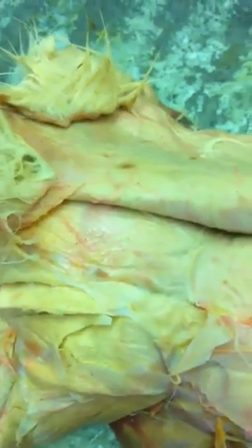What else are we missing? We're missing the semitendinosus — semitendinosus is deep, we haven't found that yet, so we'll get back to that. Sartorius we got. Piriformis — piriformis was on the side, piriformis right here.